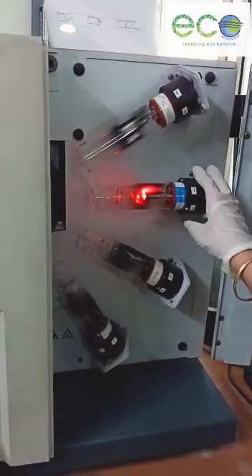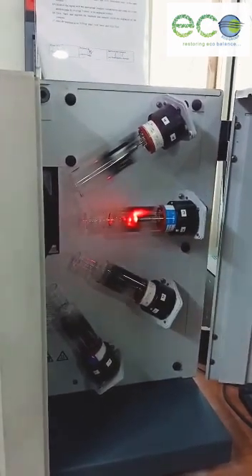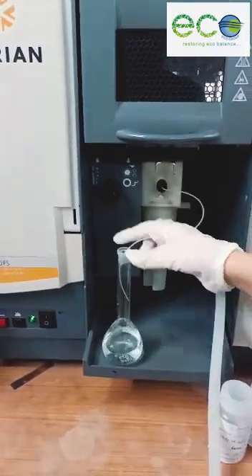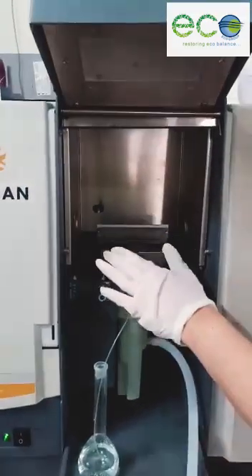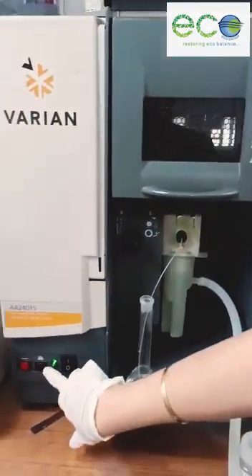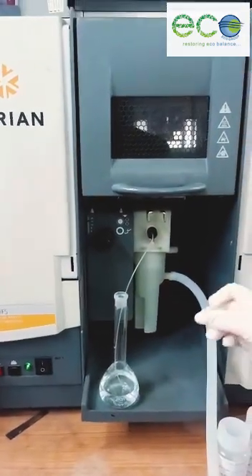This is a hollow cathode lamp. Now this lamp is switched on and the light passes from here. This is the nebulizer — I will put my blank into this. We have a burner over here, and the flame will get ignited once I press this button. Once the flame gets ignited, I will get the concentration of my sample.